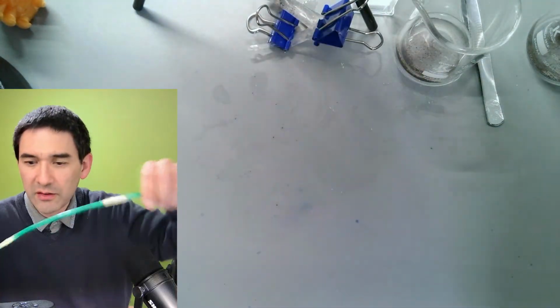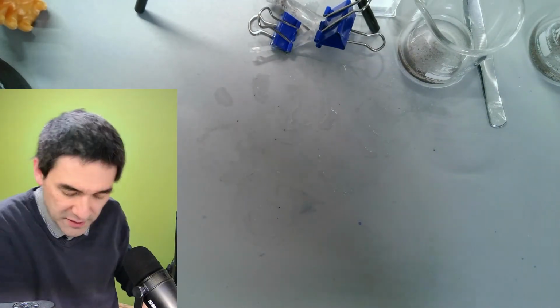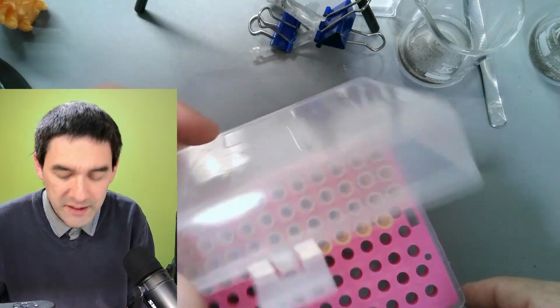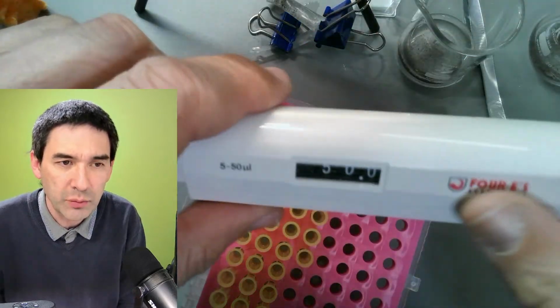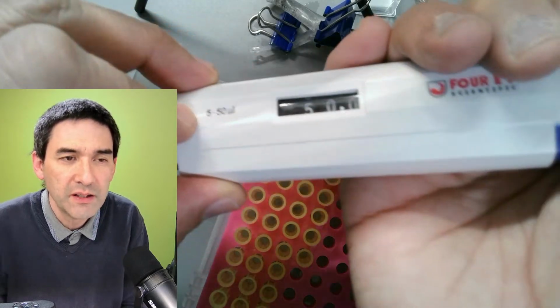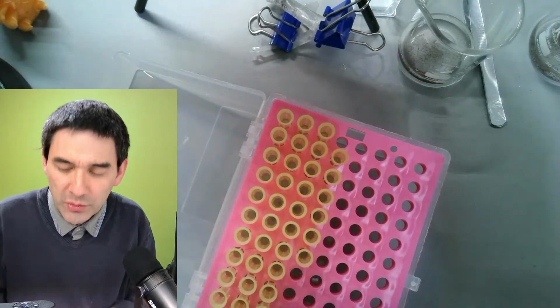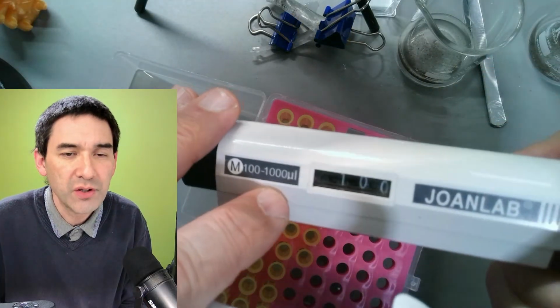Let me put this away again, the tubing. How to make thin, how do you call this, pipette tips, okay? This takes patience, and it doesn't always work on the first try. These are disposable pipette tips, and this is a so-called microliter pipette. You can adjust the volume over here, right? It goes from 5 to 50 microliters. This is the most common one that I use. I also have a larger one, but I'm going to use the smaller one. This one goes up to a milliliter, which is 1,000 microliters.